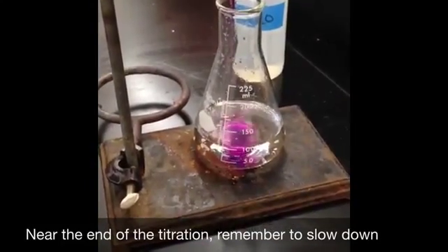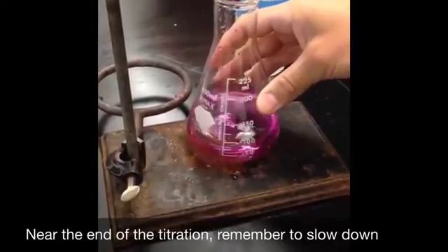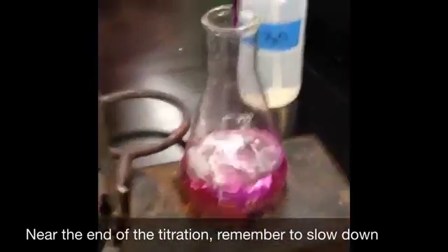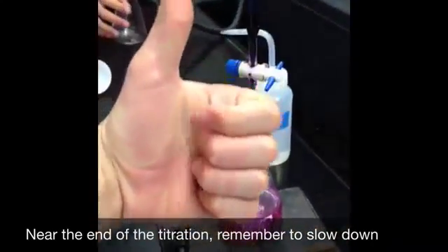Instead of titrating 1 milliliter at a time, as we approach the endpoint, it is important to titrate more slowly to ensure that we do not overshoot the endpoint. As you can see, the color of the solution is no longer changing, so the endpoint has been reached.